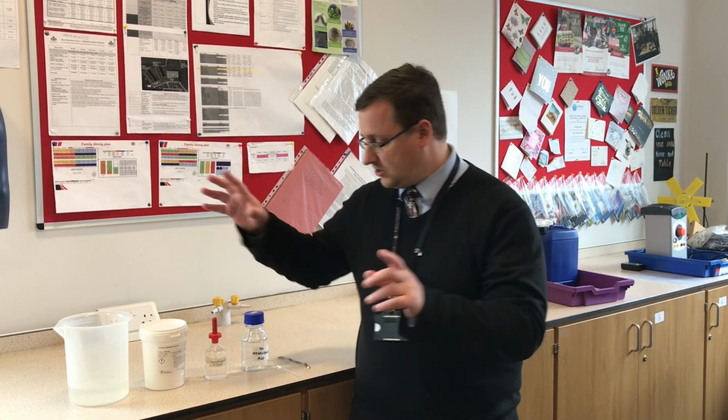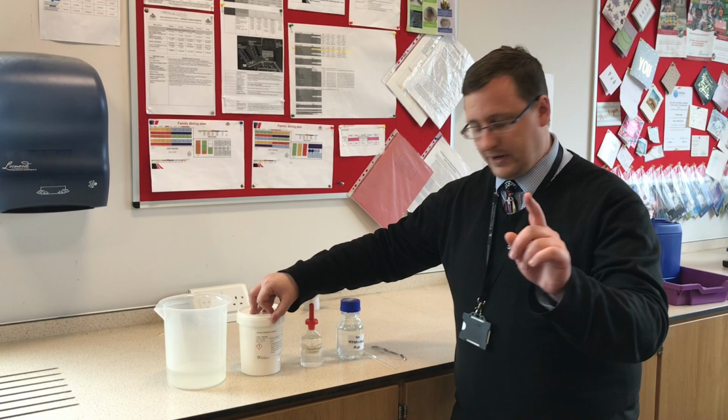Well, as we like to do in chemistry, we're going to mix them together and see what happens. And it does involve a colour change. I'll tell you that, but I want you to guess the rest. Now I'll set it up for you and then I'm going to ask you a question.